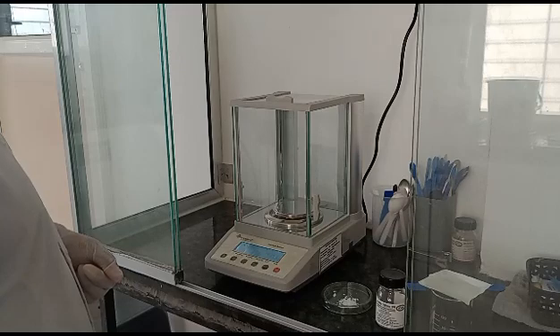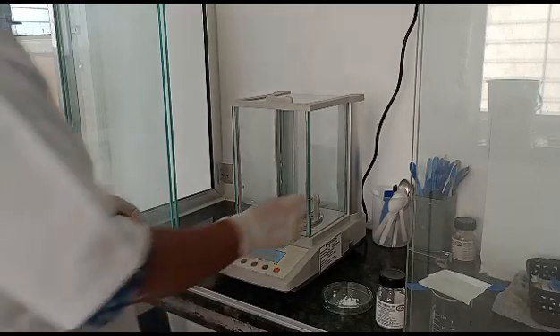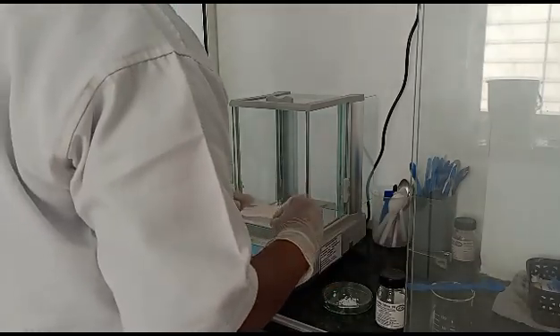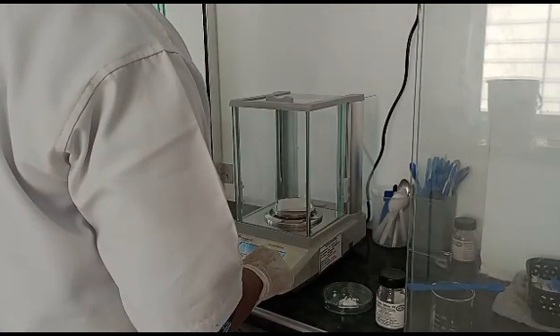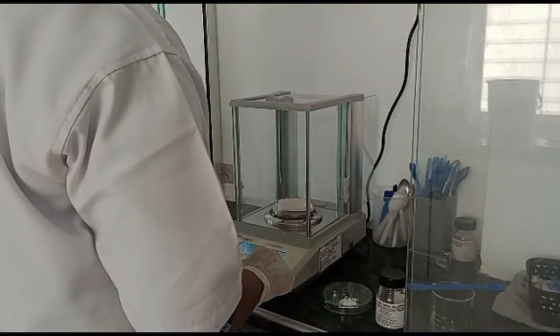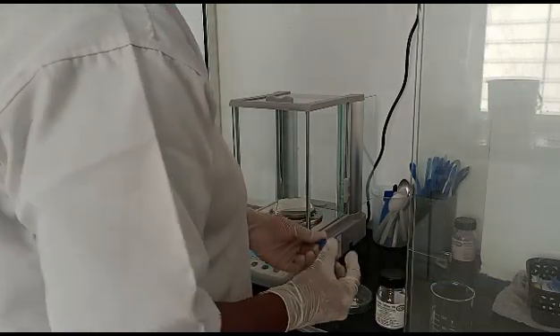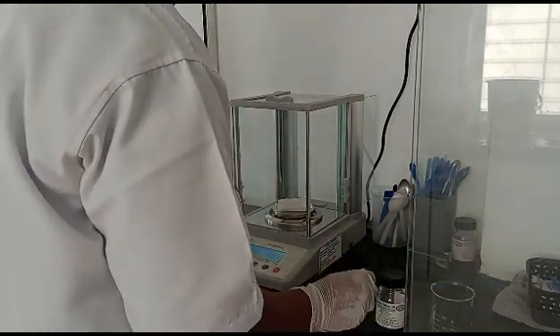Now we will weigh from this for the standardization. Take a butter paper and weigh exactly 0.1061 gram, that is 0.1061 gram of calcium carbonate.